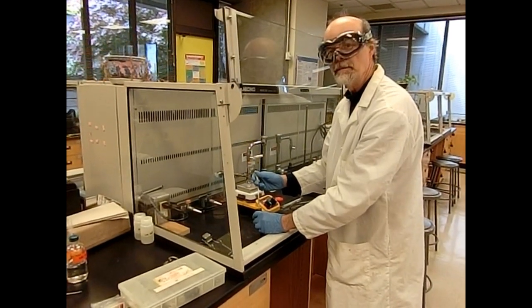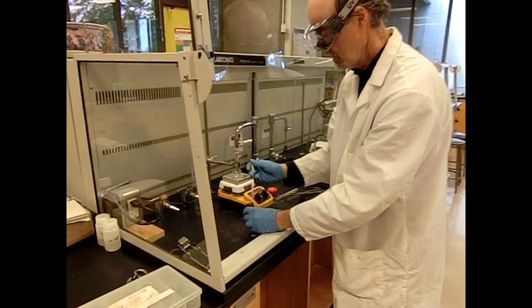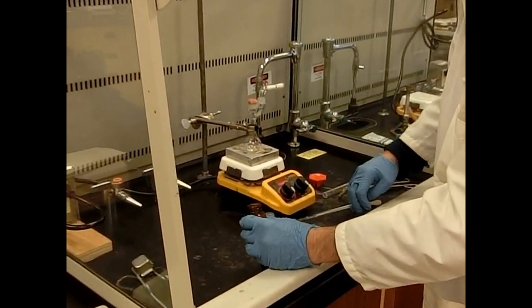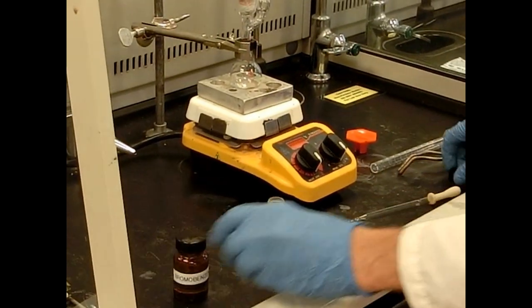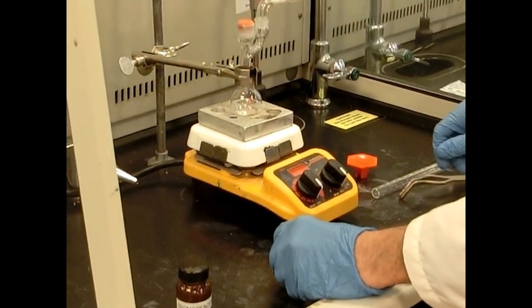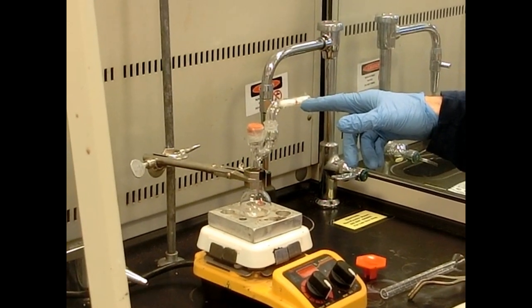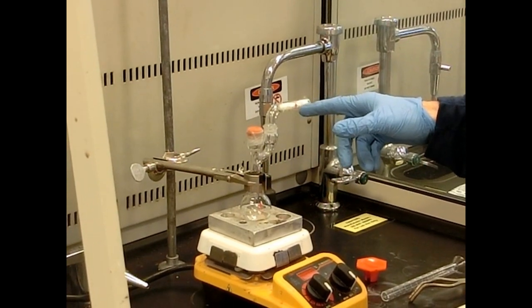We're going to add 0.8 mL of bromobenzene to the 5 mL conical vial, and then we're going to add 4 mL of ether, and then this solution we will add to the reaction apparatus shown here. A little quick tour: we have a drying tube with calcium chloride in it for the desiccant, so air can go in and go out, but it will dehydrate the air.